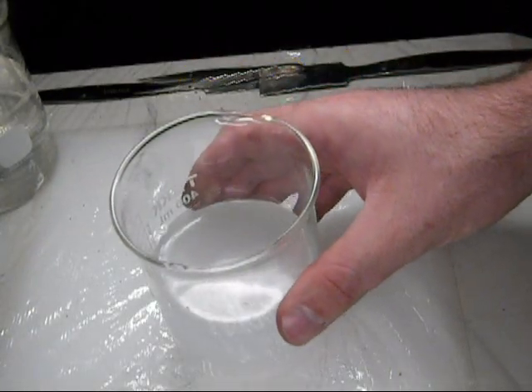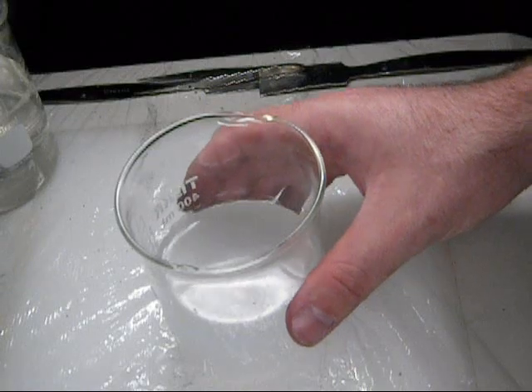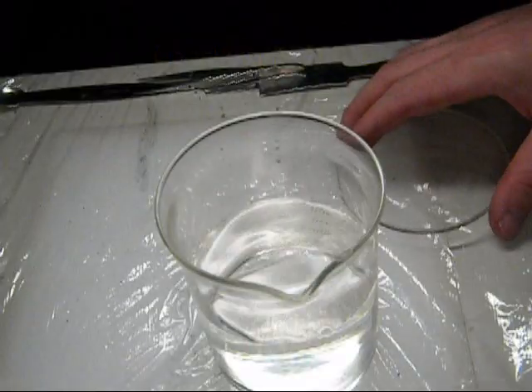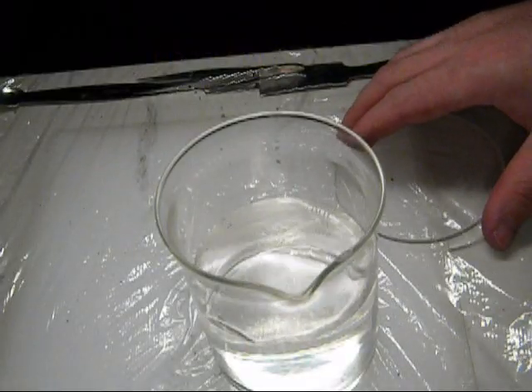There, I'd say we're done, finally. There might be a little fleck left there. Just quick, we'll check back in on our magnesium. Still a whole lot of nothing going on.